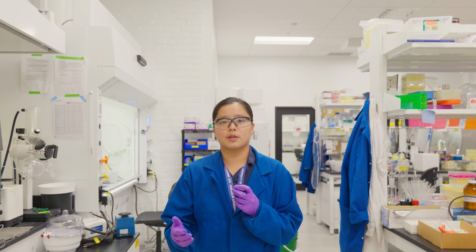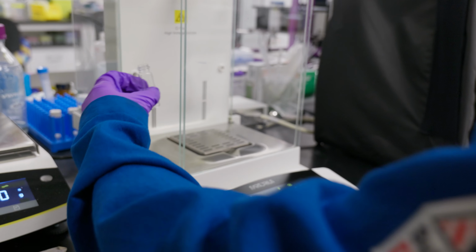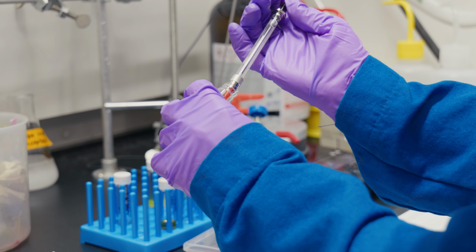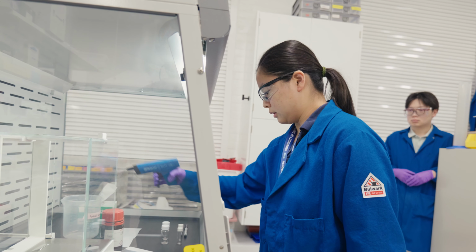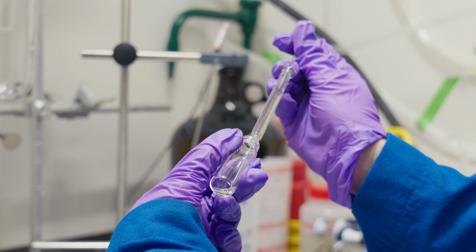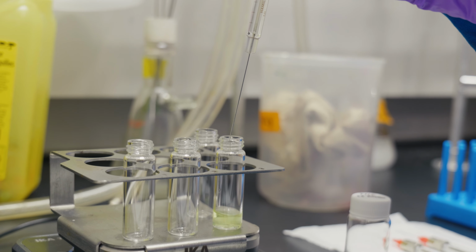So here's how it works. First, I dissolve my polymer in a good solvent, which means the entire polymer dissolves well. Usually for nanoprecipitation, this means picking an organic solvent like tetrahydrofuran. This is also the stage if I would add a drug molecule, but today we're adding a dye instead, so it's easier to see. Next, I slowly drop my polymer solution into an anti-solvent, in this case, water.